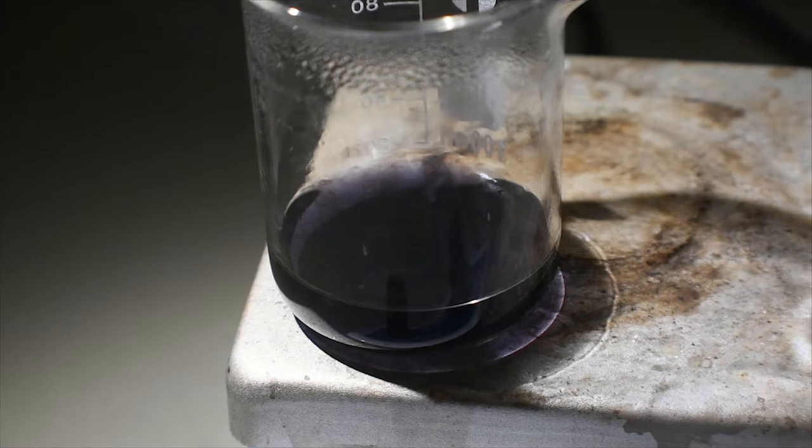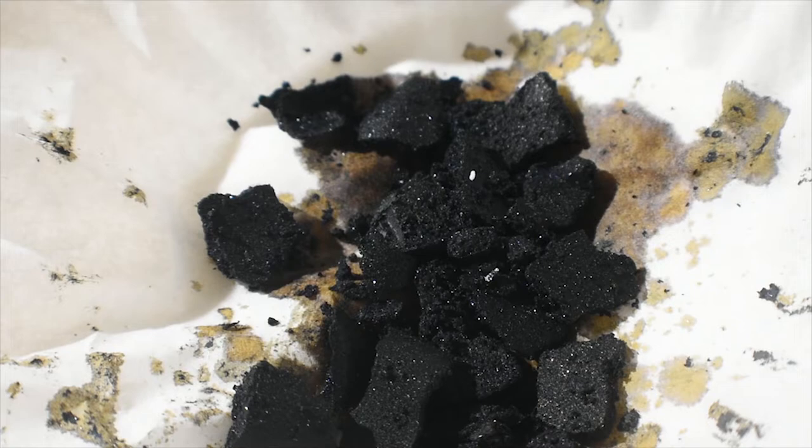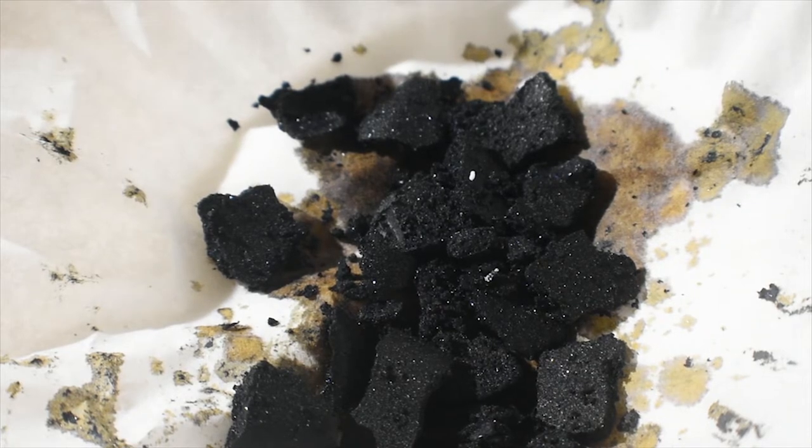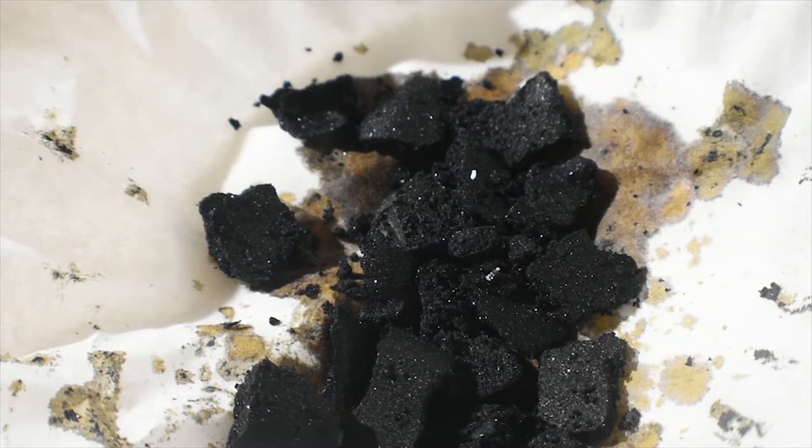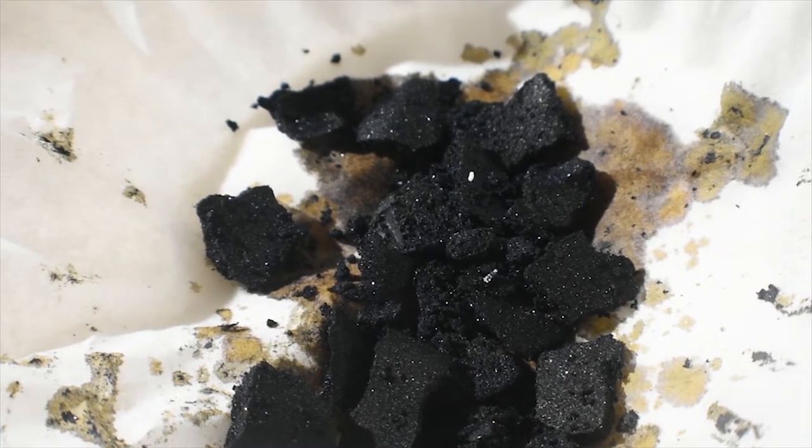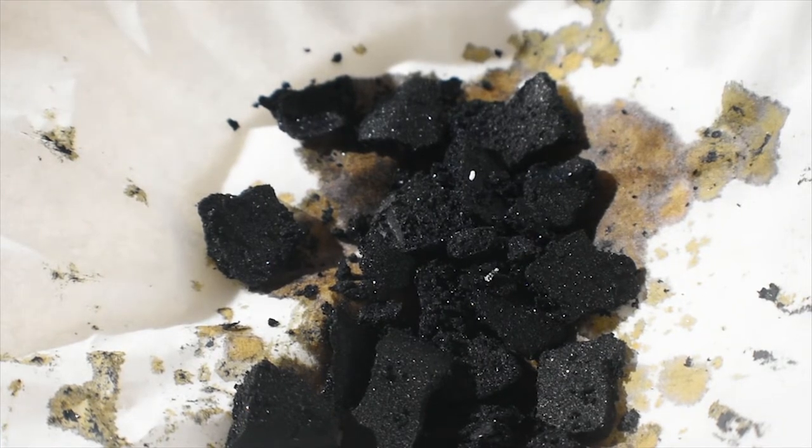I don't know why that is. As we can see, the product is still sort of in these big chunks, as it is kind of a hard solid to break up. And because it is a little bit damp, still, with the reaction mixture, I'm just going to let it dry out for a few hours. So that concludes part one of this video.